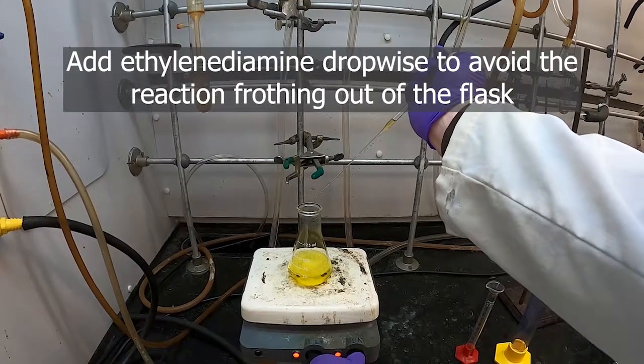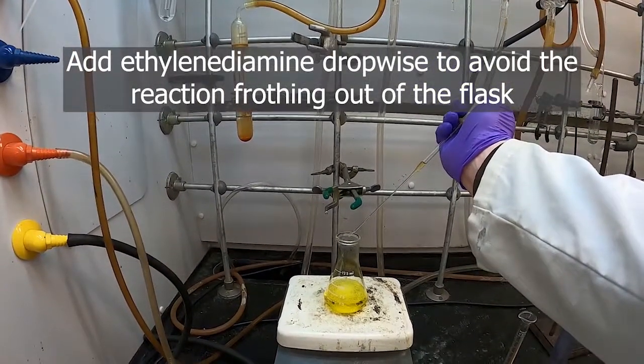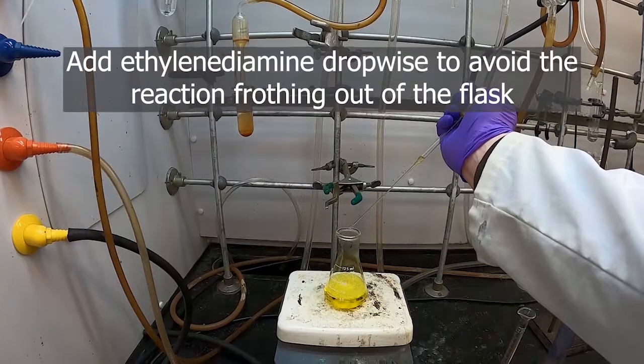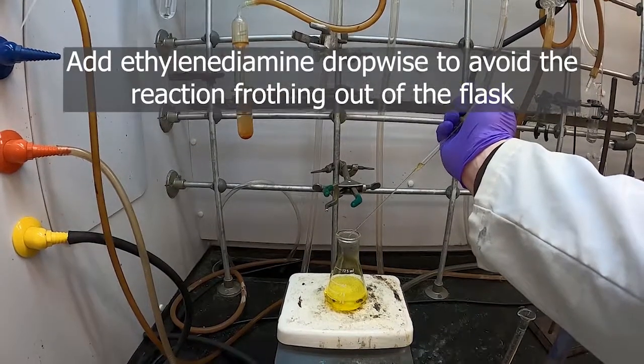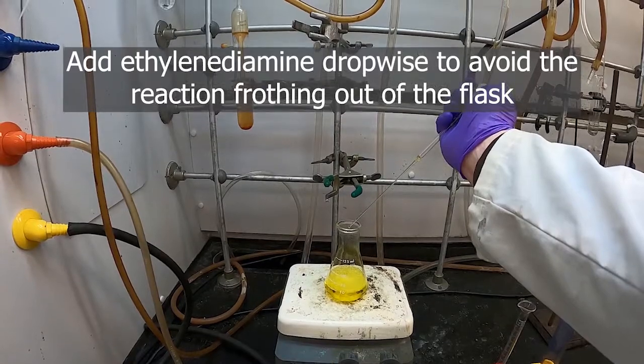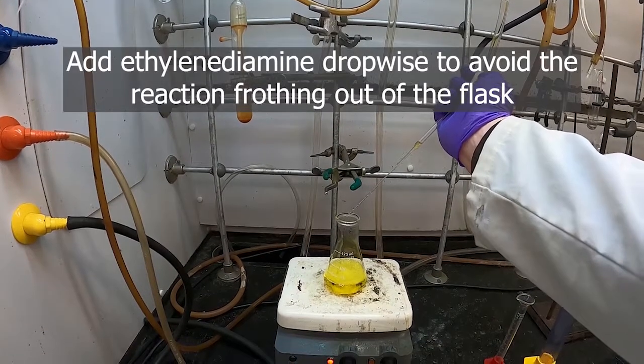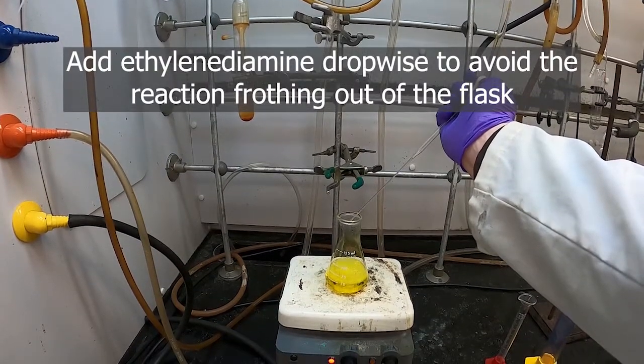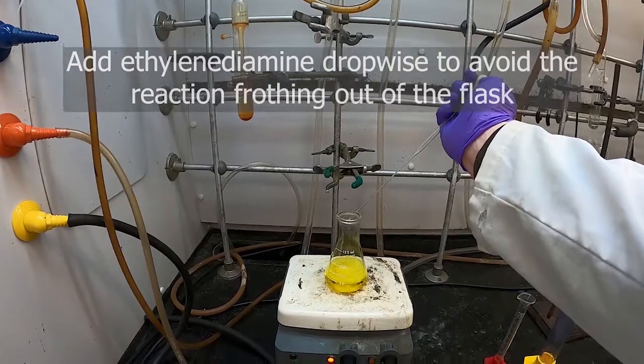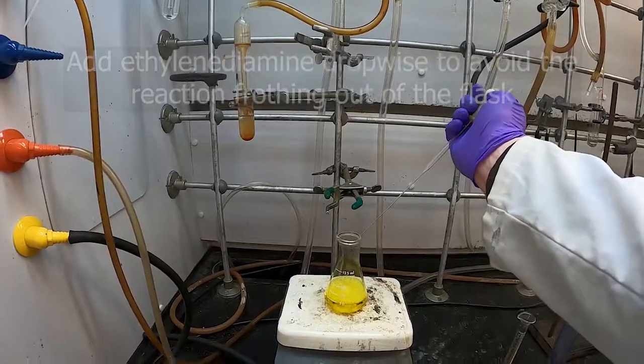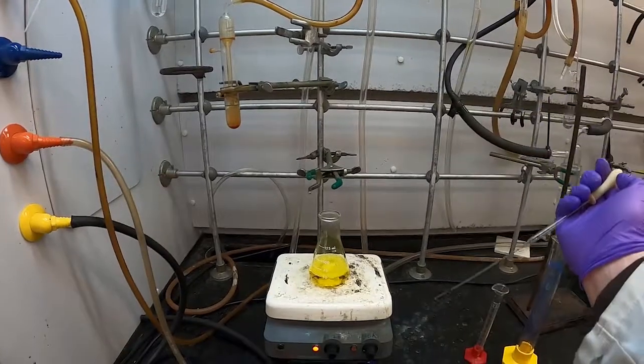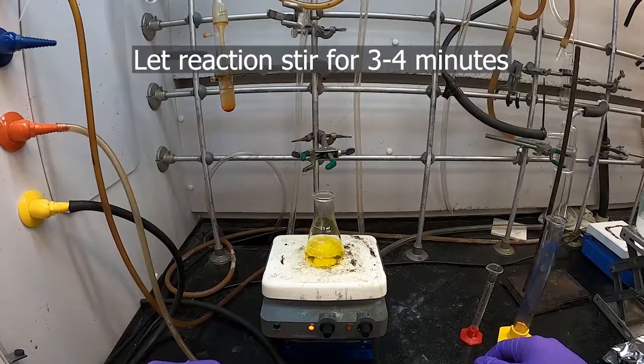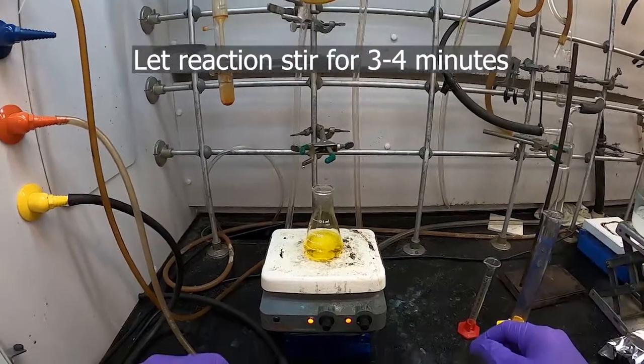I'm going to turn the heat down just a little bit more. And there we go, it's all in there now. So now we'll let this stir for three and a half minutes and then we'll put it on our ice bath and let it cool down.